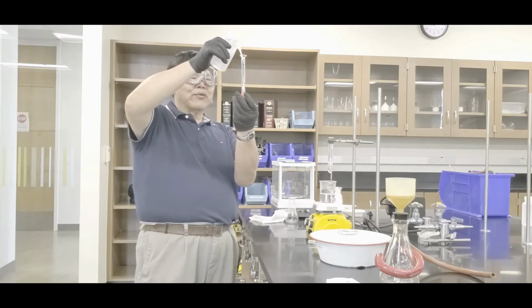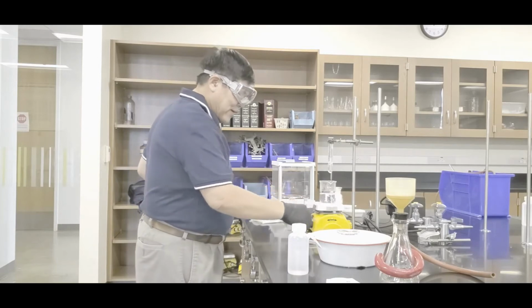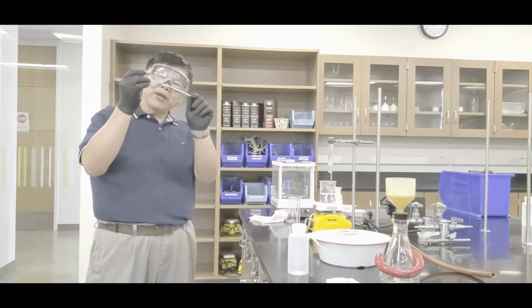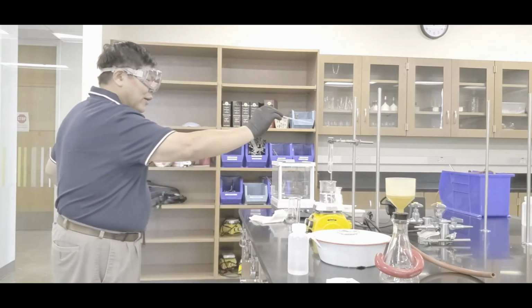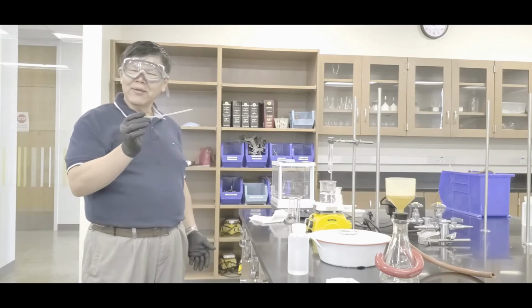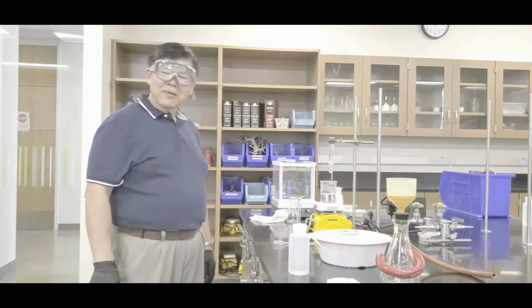This is a 10 milliliter graduated cylinder, so about 5 like that. And what you want to do is get ready. So you need this disposable pipette, long stem, so you can get an arm's length away from this, and you'll be adding water once it's ready. Okay? I'm going to wait a minute or so.